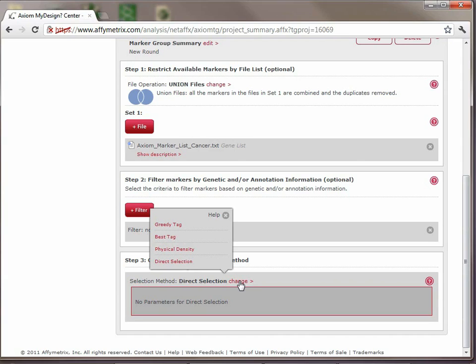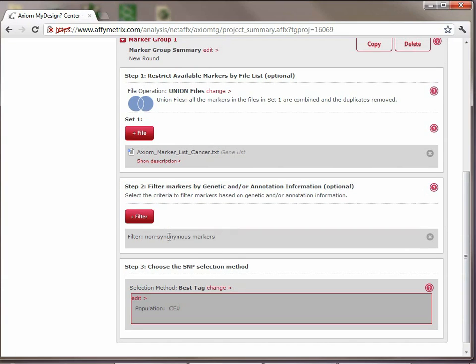That means we have a set of taggable markers that, if you pick direct selection, will not be on the array. So what would be a better choice in this case is the best tag. So that for all the validated markers within the cancer genes, they will go on the array that are non-synonymous. And then also for the non-synonymous that are in there that weren't validated, the best tag from the Caucasian population will be put on the array as a proxy for it. So we'll select best tag for that. Because we're interested in Caucasian, we check and make sure that the population here is Caucasian. If we're interested in either ASI or YRI, you would click the Edit button and be able to change that. So this is our first marker group, looking at the non-synonymous markers in cancer-related genes.